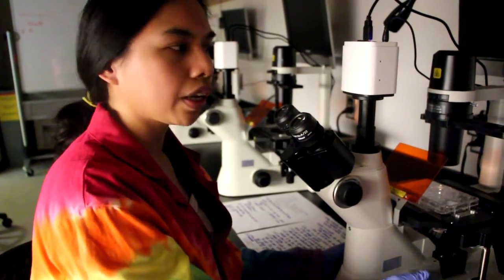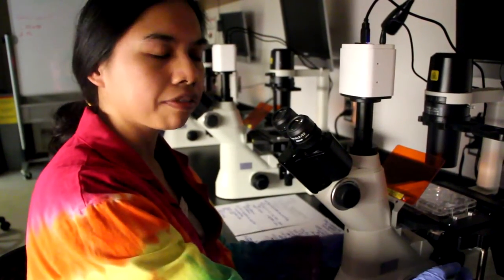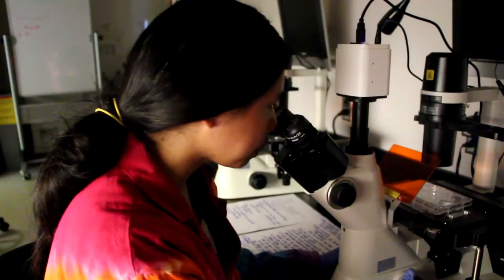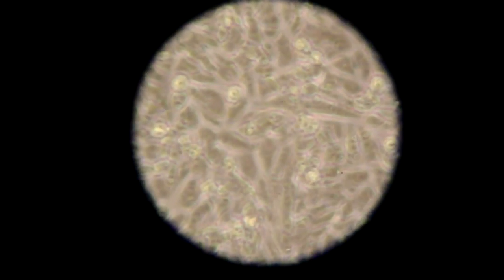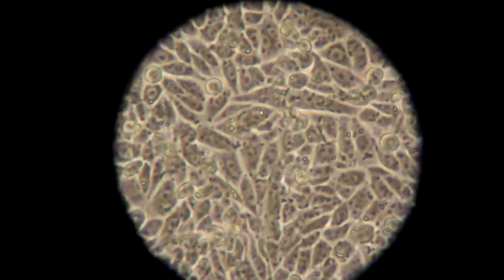Once it's all the way towards the wall and it can no longer go any further, look through the eyepiece and then slowly turn the knob towards you until the cells come into focus.